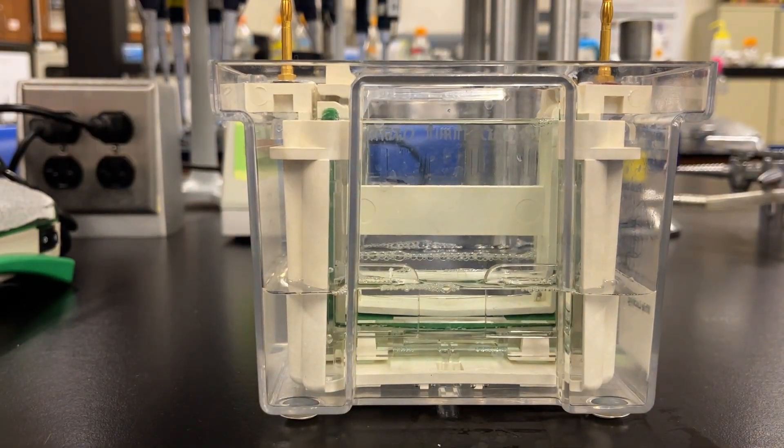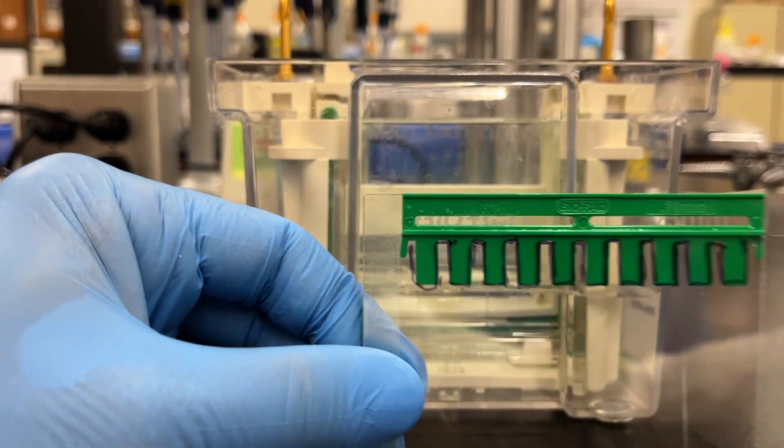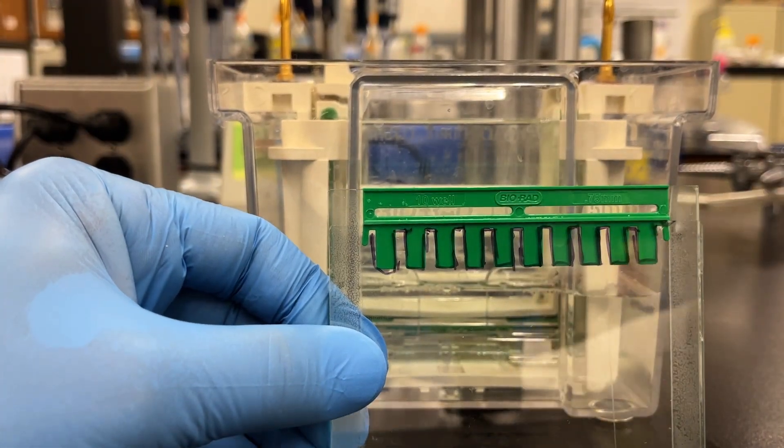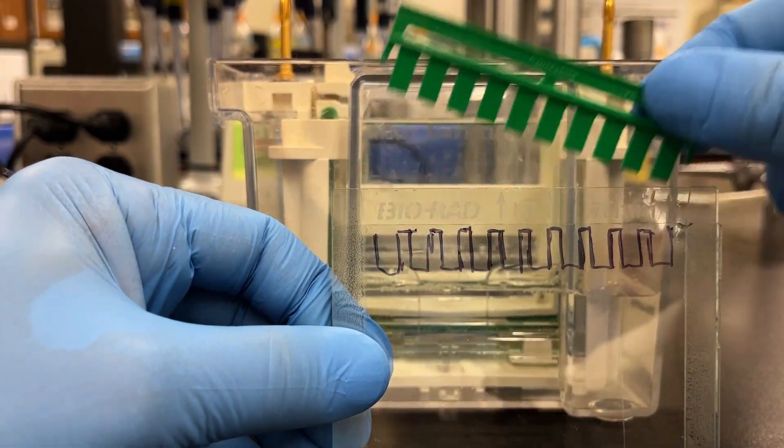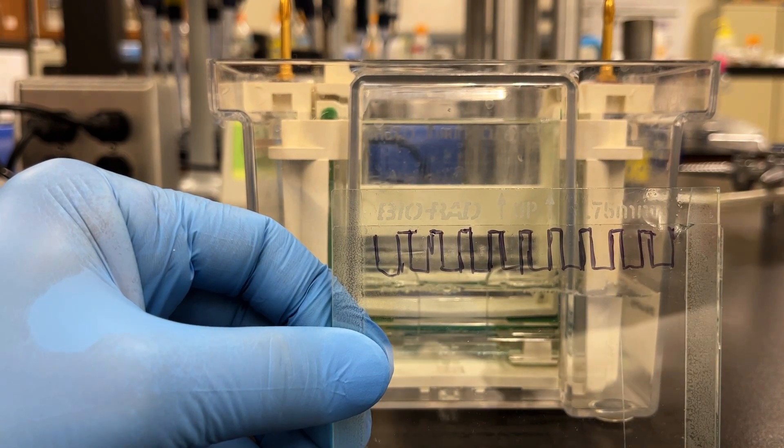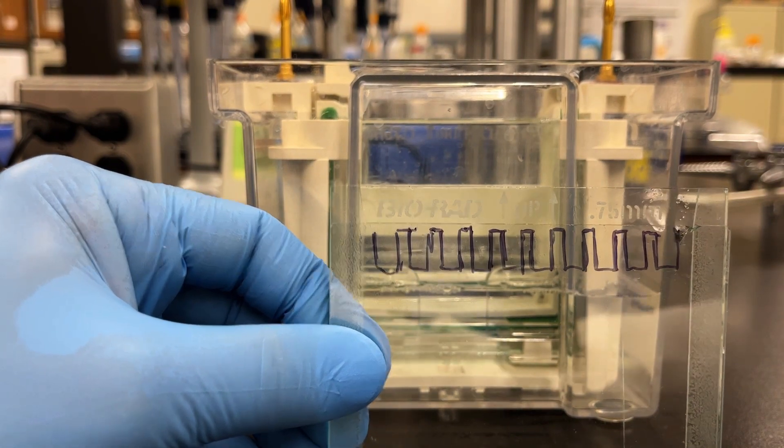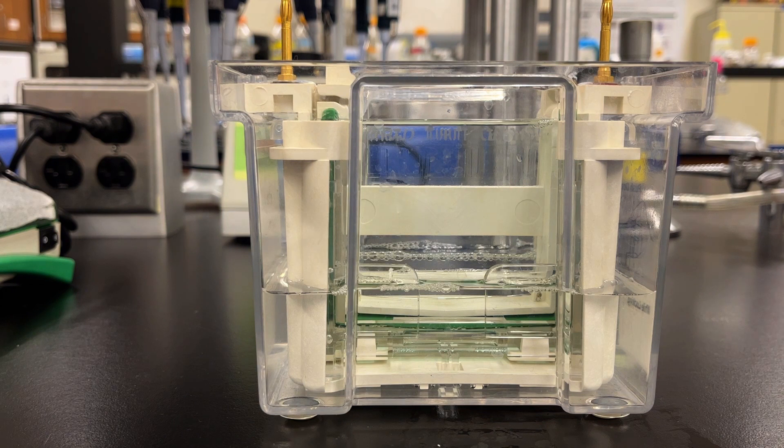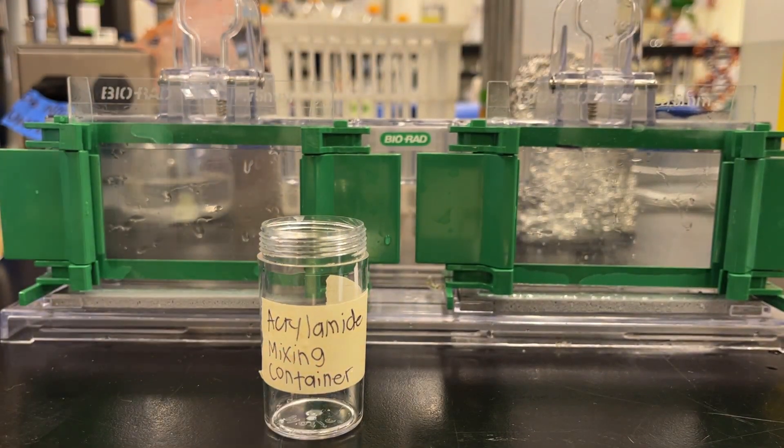I'm going to flash forward a little bit to the future because I forgot to do this, but it helps to draw the wells in the comb that you put in. It makes loading so much easier. There are a couple of tricks we can use to help with the loading, but this is something you can do now. All right, back to present day.